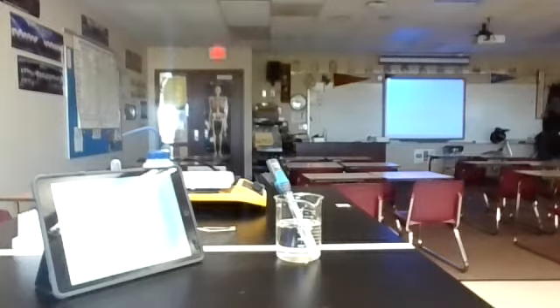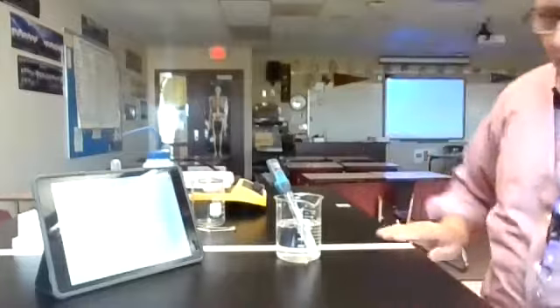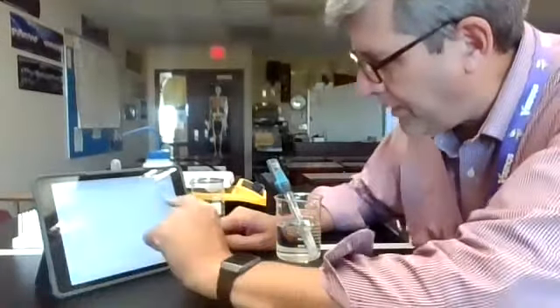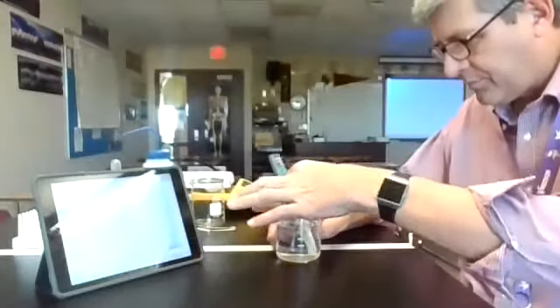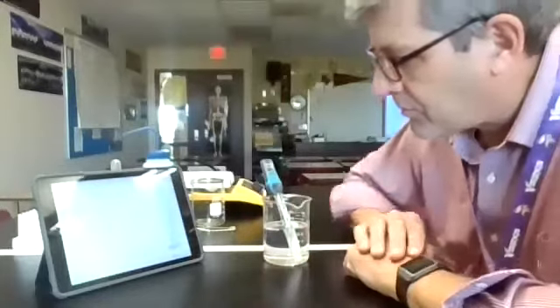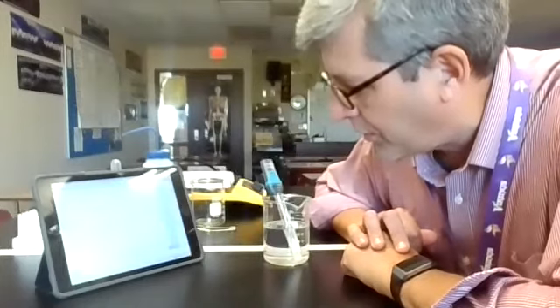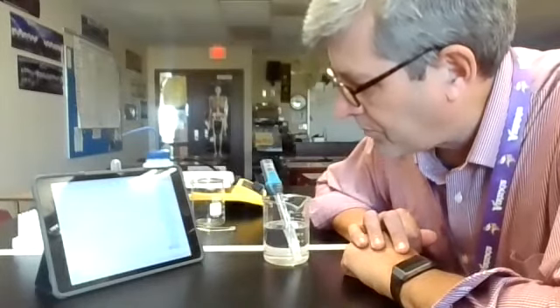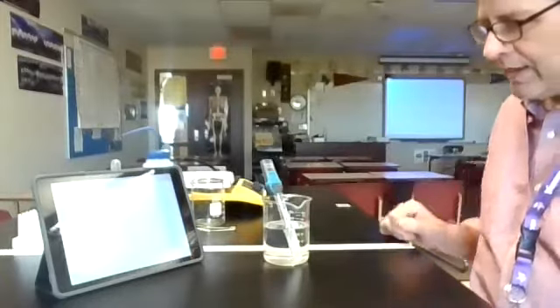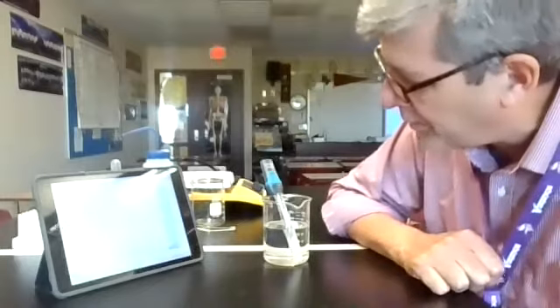If this was 100 degrees Celsius, I wouldn't be picking it up with my fingers, but 80 is sort of doable. It's not that ridiculously hot that we can't handle it. And you can see what's happening. The cooling is starting to slow down. And this is solidifying already. And we will let this go down until it gets to about 20 degrees Celsius or so. And you can see as this goes along, it also starts to flatten out the curve as more and more of this stuff finishes changing back over to a solid.